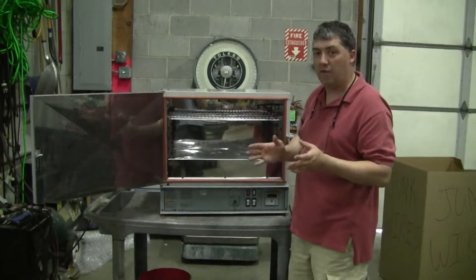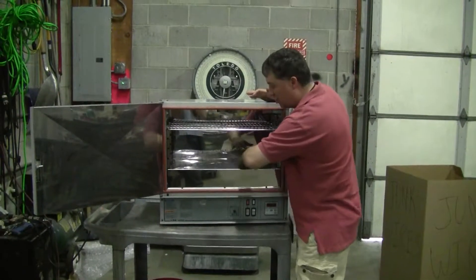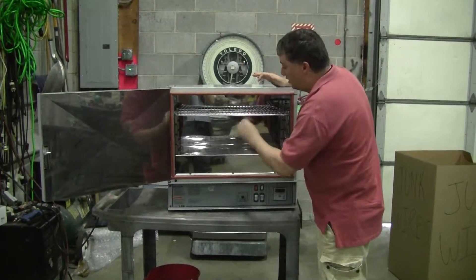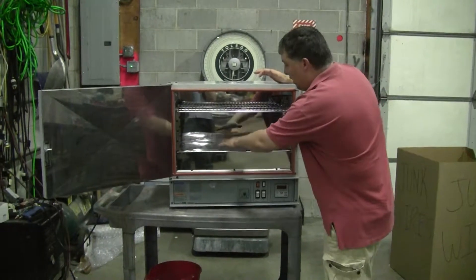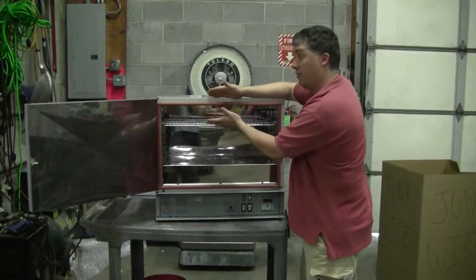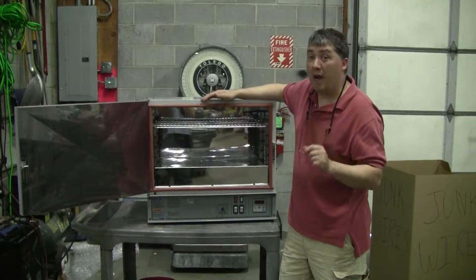In a gravity oven — what does a gravity oven mean? It means there's heating coils at the bottom, just like on your home range; there is no fan. You're going to energize those coils, the heating elements are going to heat up, heat is going to rise. You're going to get a temperature profile — it's going to be hotter on the top than the bottom. That is a gravity oven.